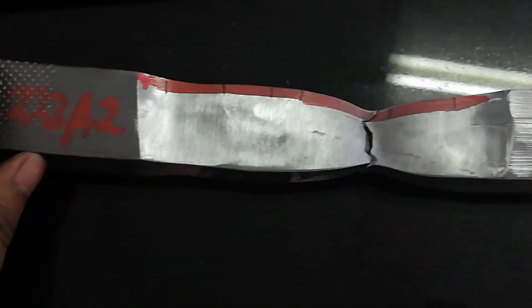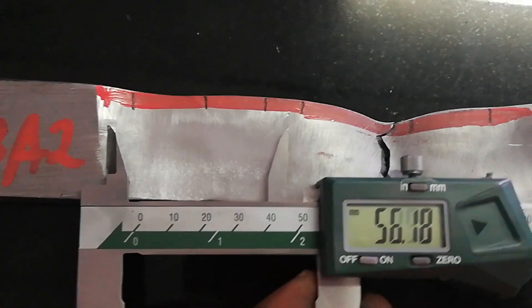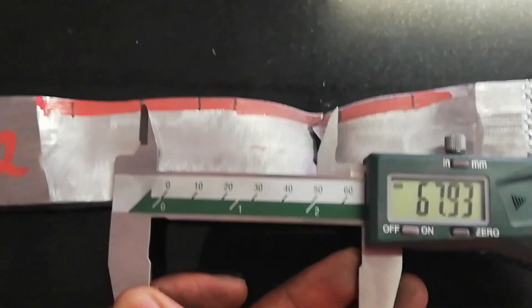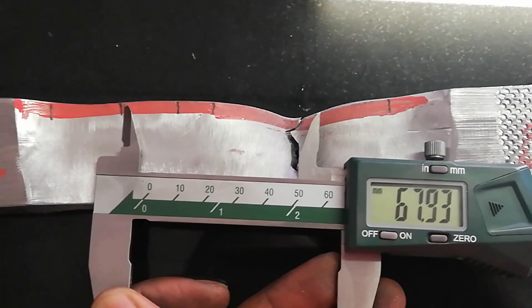Now I can measure my extension. Previously it was 50mm, so now if I measure the extension — you can see my marks there — I'm at almost 67.93mm, so that's 17.93mm of extension.